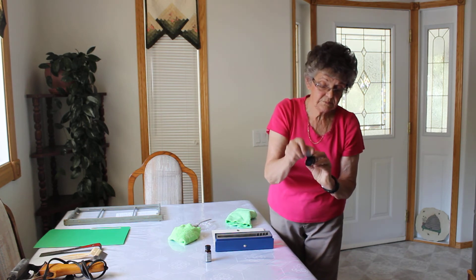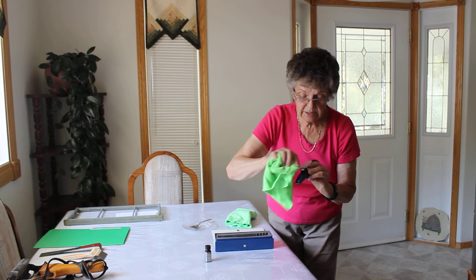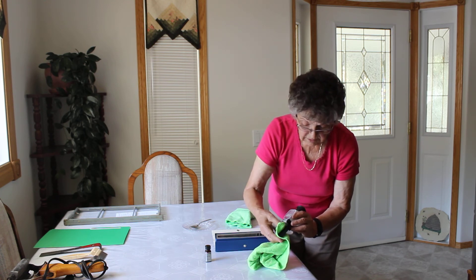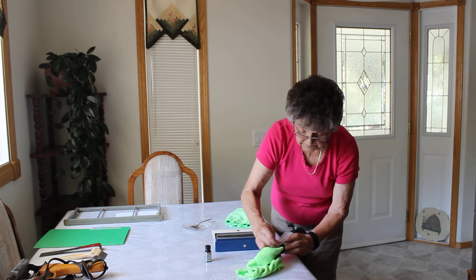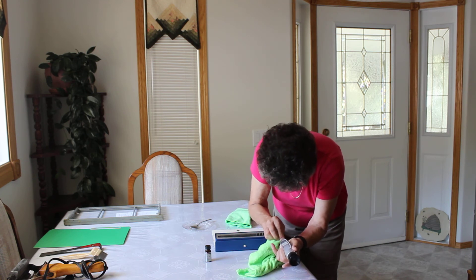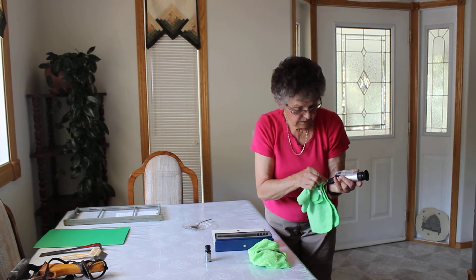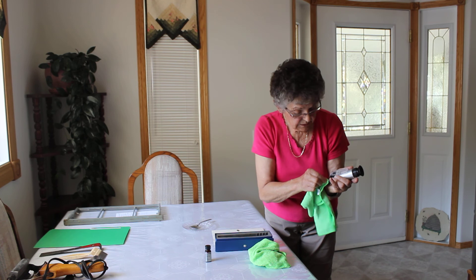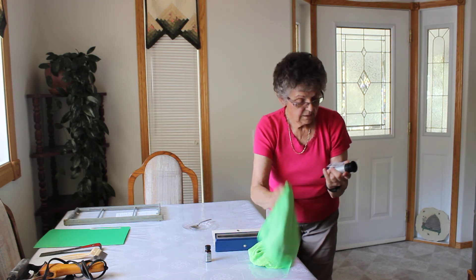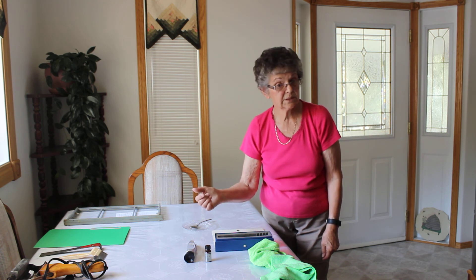When you're finished, take this back and wash it very gently. Do not use a running tap or anything around this. A very soft cloth is very, very important for doing this. Get all that honey off — it's going to take a little bit. Make sure you get in that crack all the way around. Then take a very soft cloth and get right in that crack all the way around and dry it off. Make sure it's very dry, and generally leave it out for a little while so the air dries it as well, because there may be some tiny bits of moisture in there.